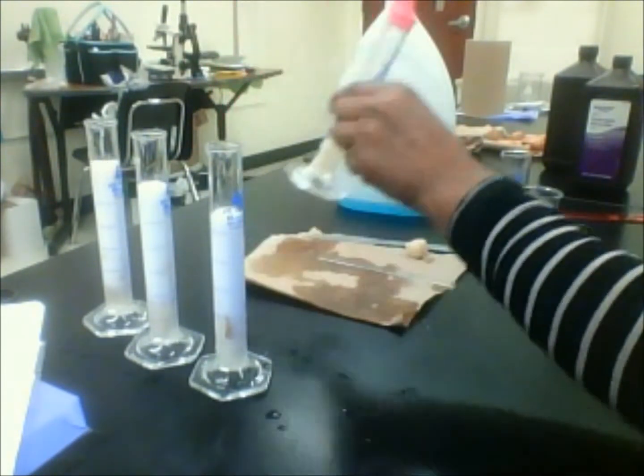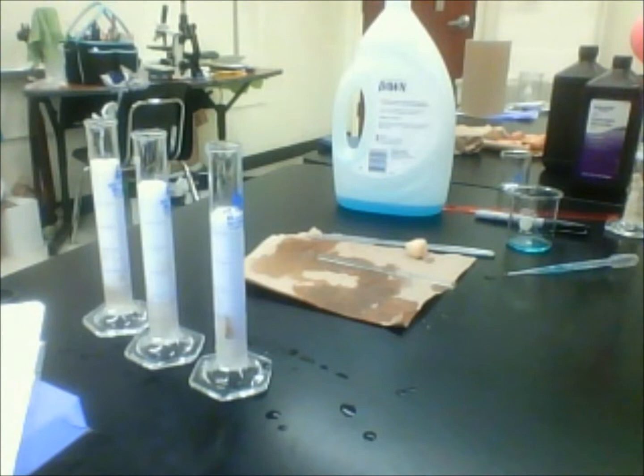Okay, so we have a little under 2 minutes left, and then we will record the height of the bubbles, and hopefully we have that amount of time, because that one that we cut in eighths is just growing and growing and growing. I hope it does not go past the amount of volume that we have in that graduated cylinder, or the size of it.